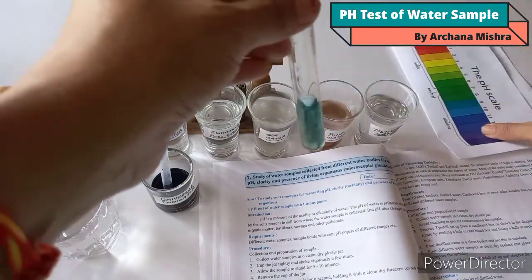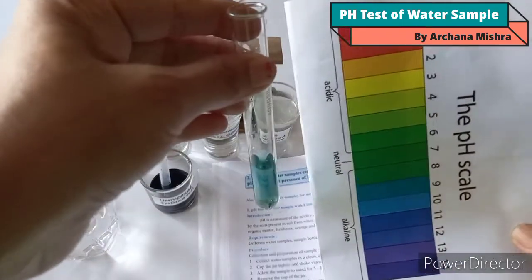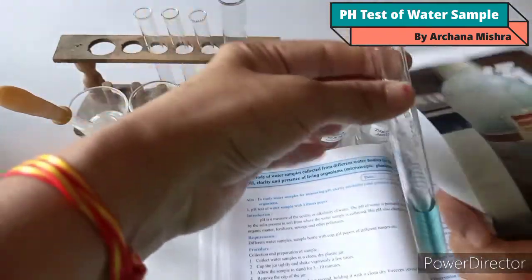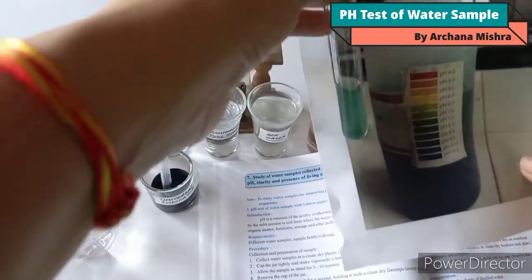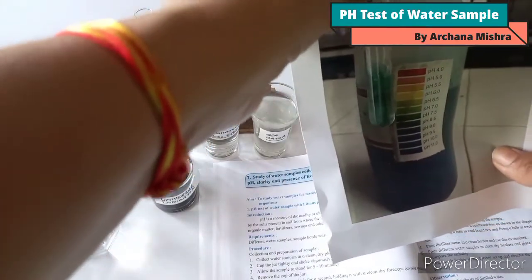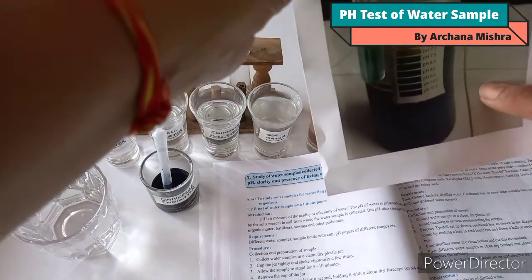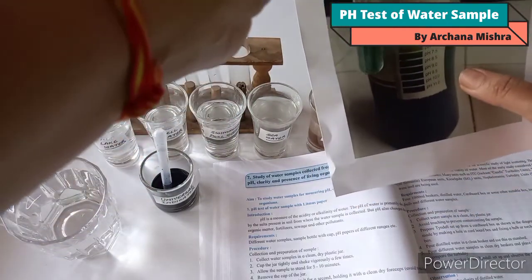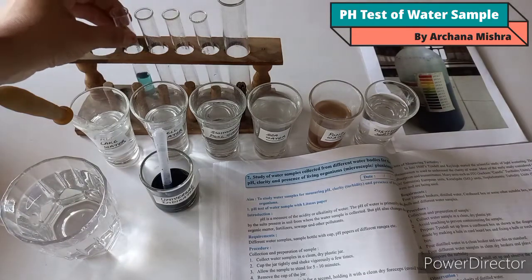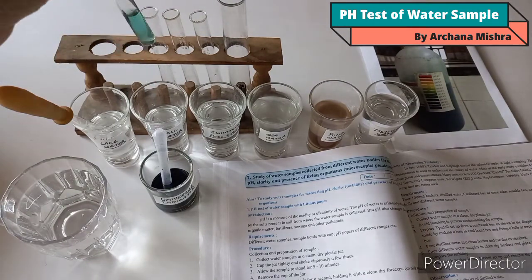We can also match the color from the color chart on the bottle. So the pH of lake water is 7.5 — that is alkaline. So lake water is alkaline in nature.